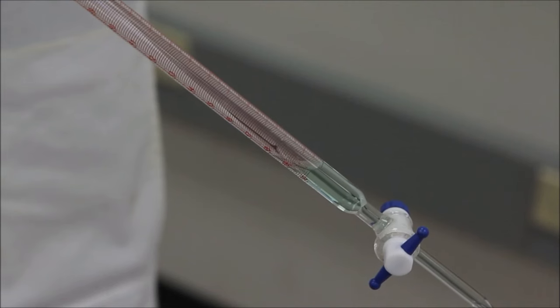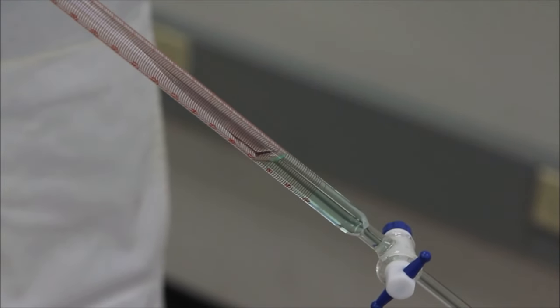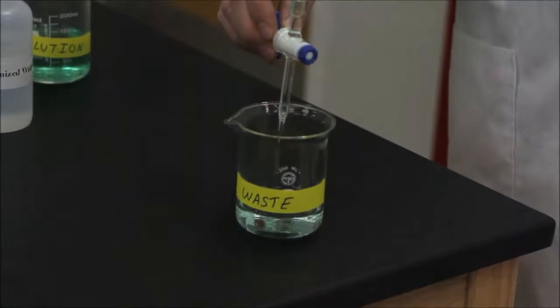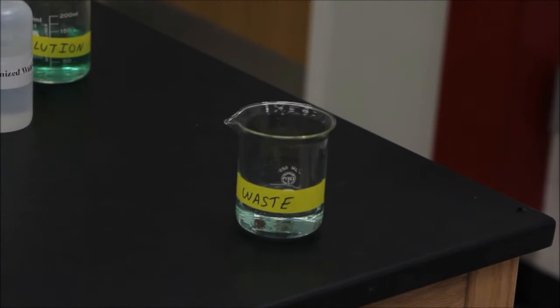Next, use your solution to rinse the burette in a process otherwise identical to the cleaning step. Repeat this rinsing process two additional times with small volumes of your solution.